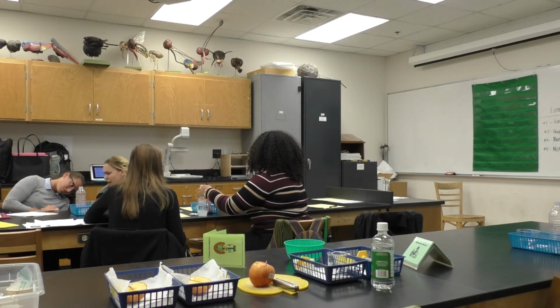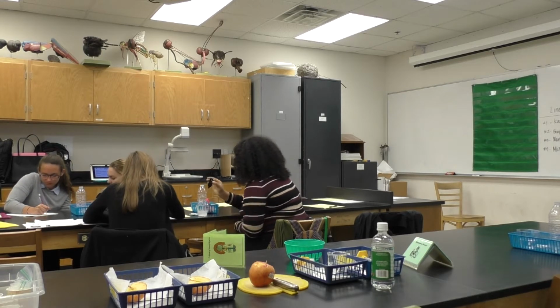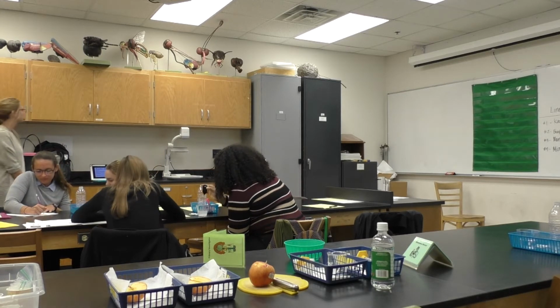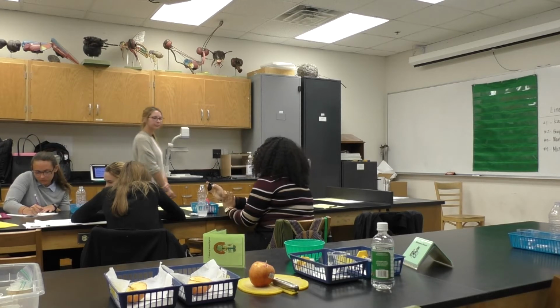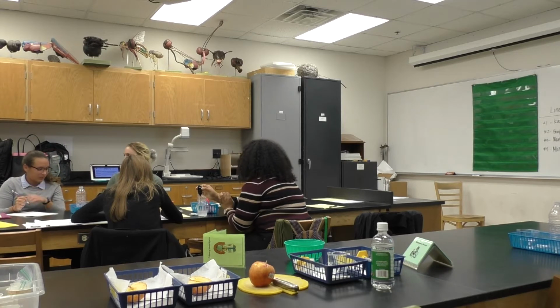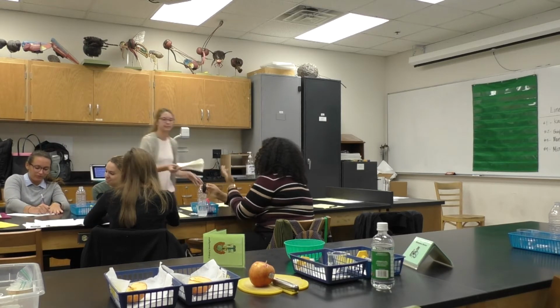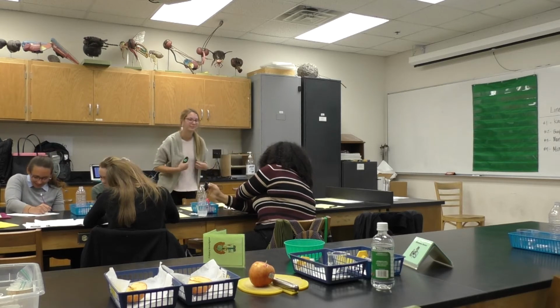So make sure you're answering all the additional questions for activity 1. Can we have a paper towel? The appearance, it's bubbly. It doesn't look as clear. There's less bubbles.